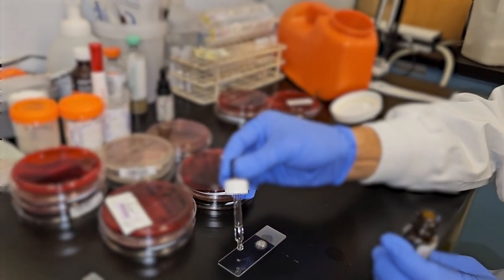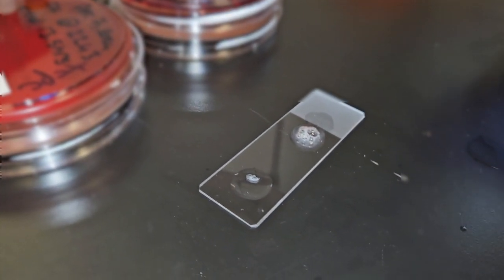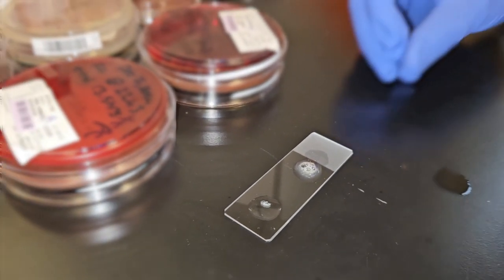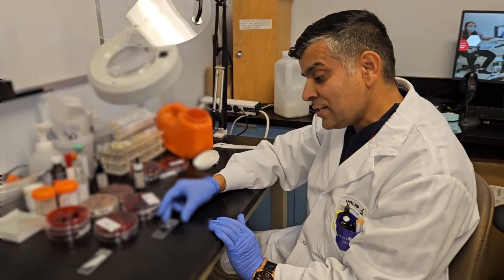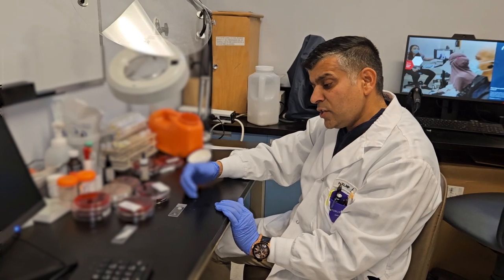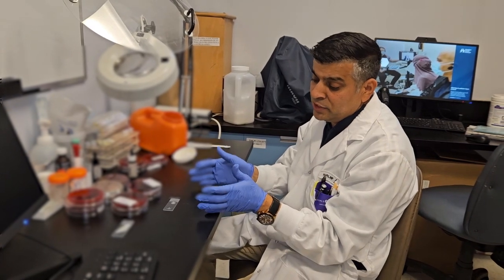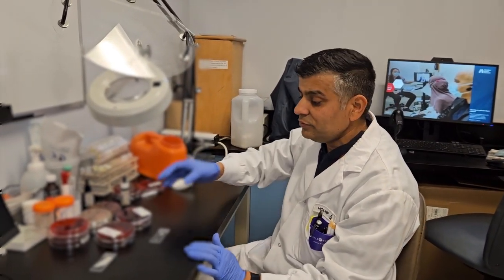Moving on to the second one, my second test bacteria, I did the same thing, and you do not see any active bubbling like before. So the interpretation is, the one which gave us active bubbling immediately after dropping the solution is catalase positive, possibly Staphylococcus group, versus the second one, which did not do any bubbling, is Streptococcus. So it is helping me bring my identification onto Staphylococcus and Streptococcus respectively.